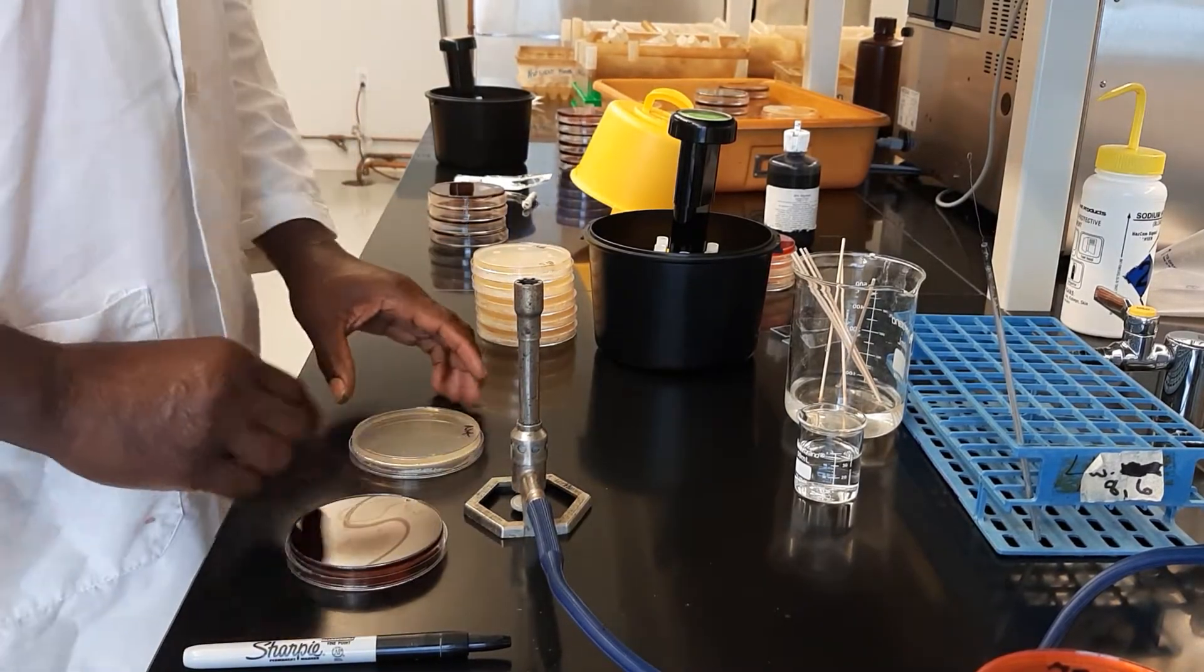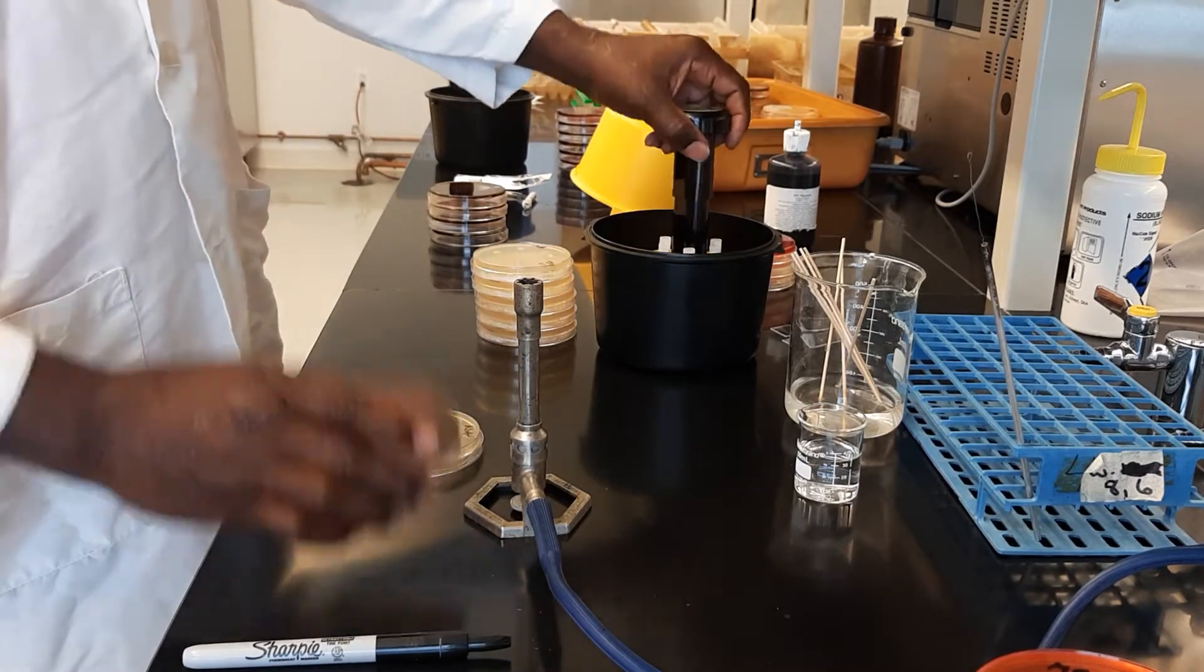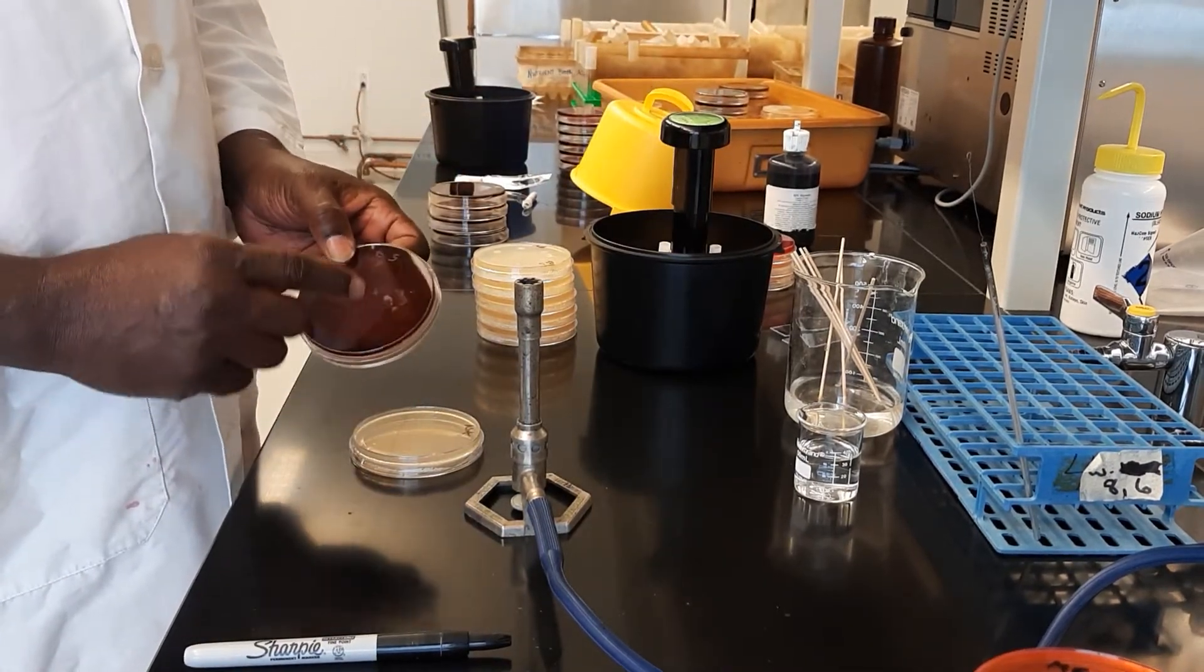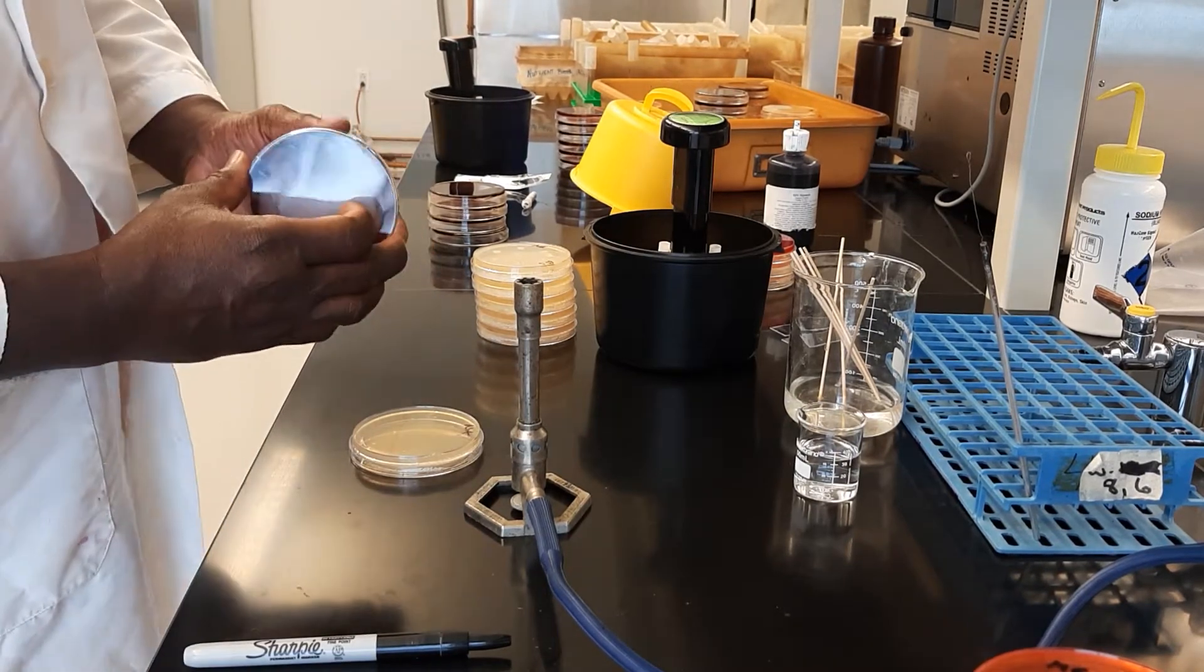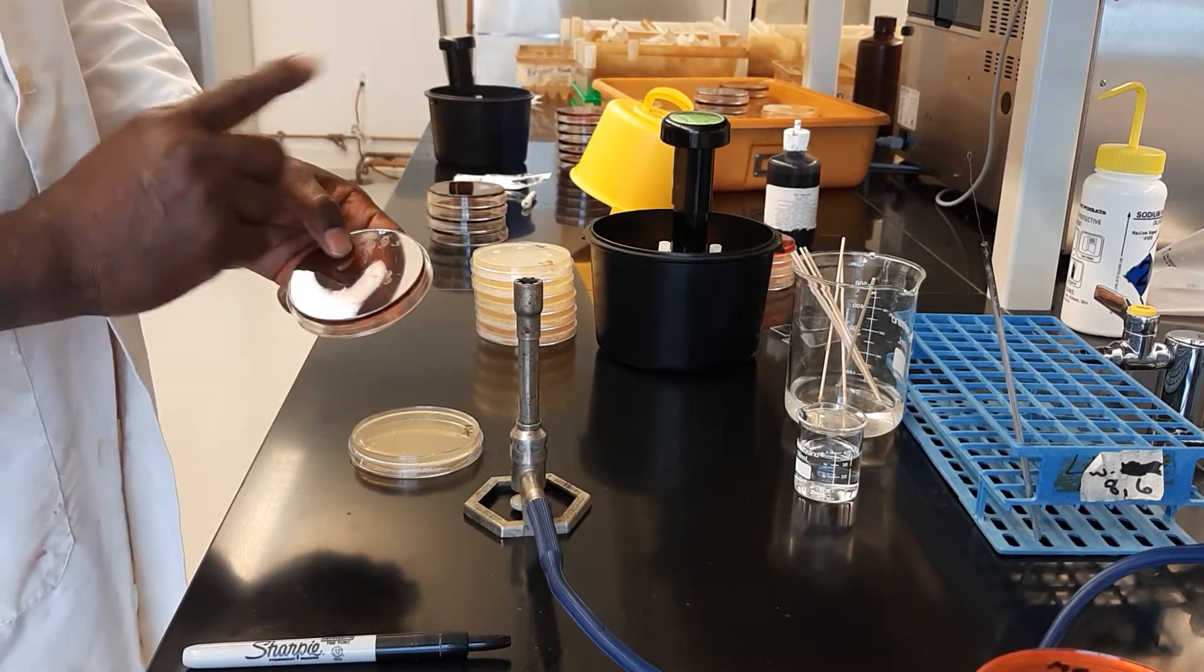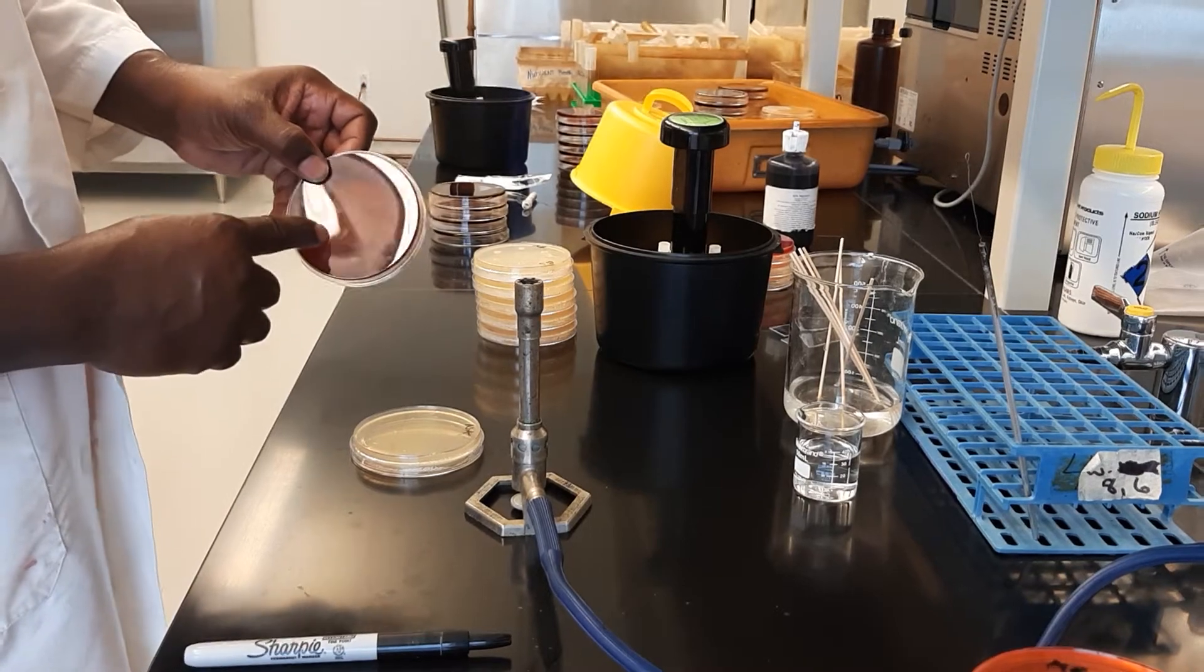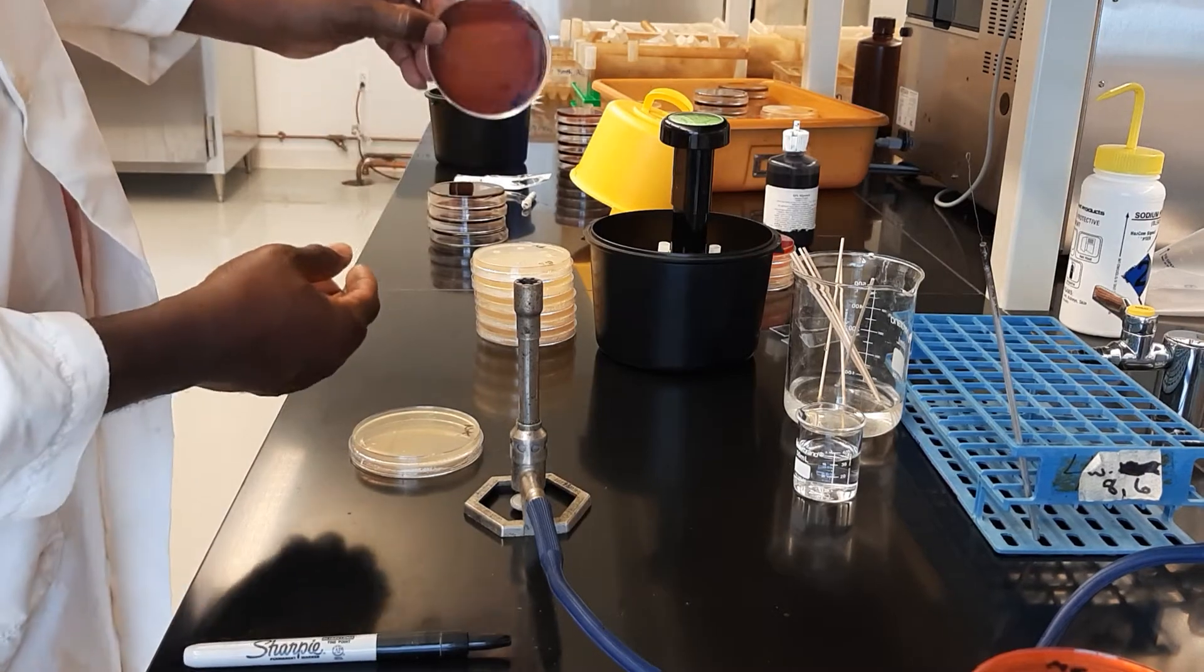We're about to examine the effect of these antibiotics on Bacillus subtilis. We have Bacillus subtilis growing on a blood agar plate here. I've been using some of it to inoculate other plates. When you look at blood agar, you should try to identify alpha, beta, or gamma hemolysis.